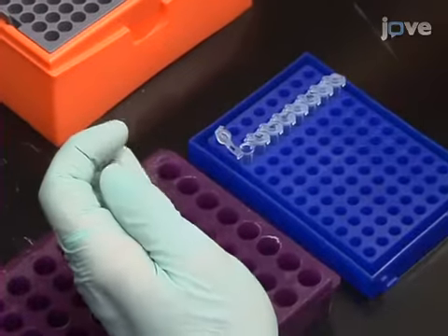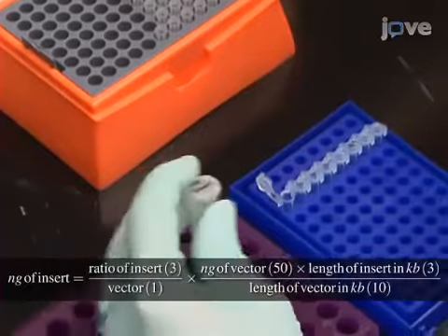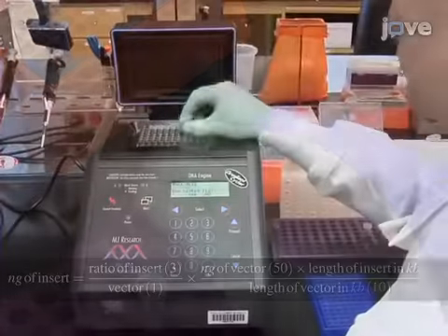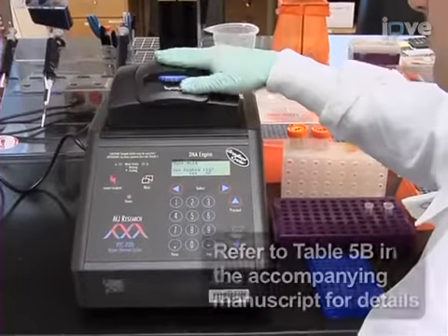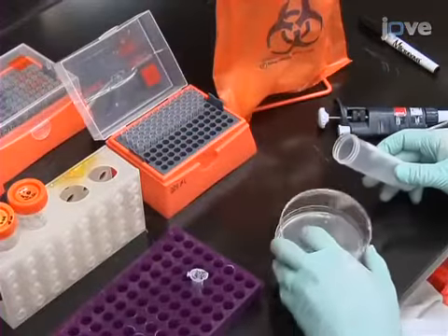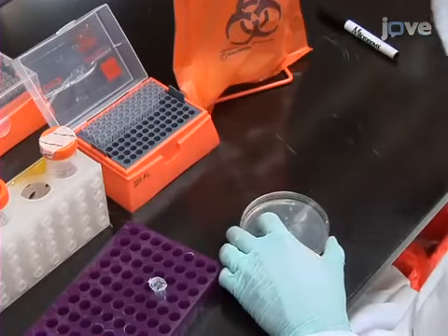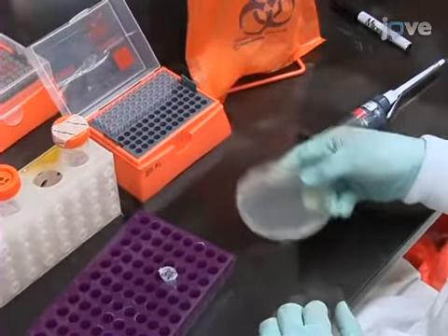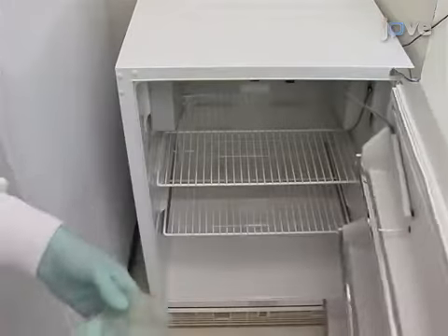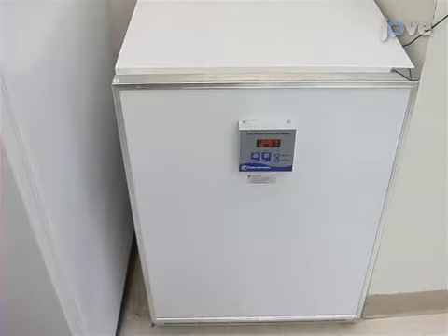Next, prepare the ligation reactions using purified LTR GAG insert and MJ4 vector DNA at a 3:1 insert to vector ratio. Incubate the ligation reactions overnight at 4 degrees Celsius. Then, transform JM109 chemically competent bacteria with ligation products, spread on LB agar plates with 100 micrograms per milliliter ampicillin. Grow transformed bacteria at 30 degrees Celsius for at least 22 hours.